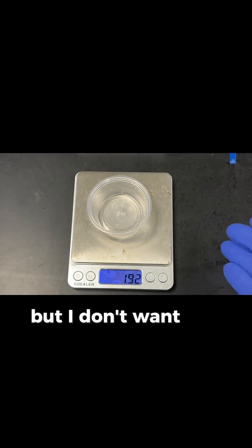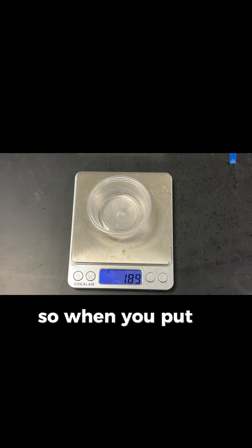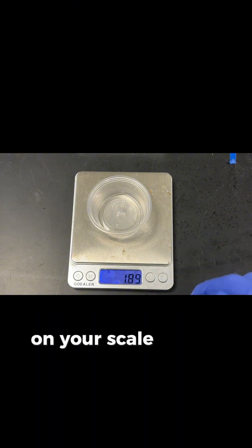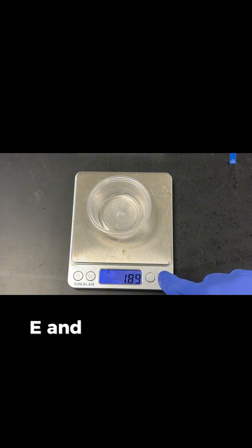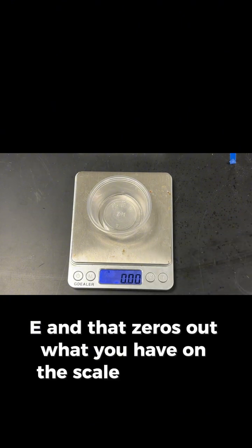But I don't want the mass of the cup included in my measurement. So when you put a container that you don't want the mass of on your scale, you're going to push the T. T stands for tare, T-A-R-E, and that zeroes out what you have on the scale right now.